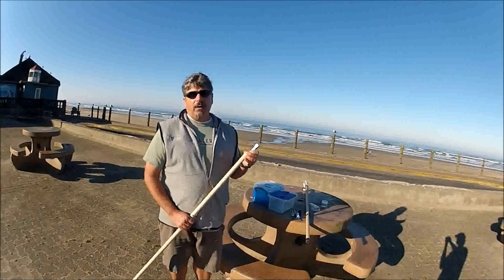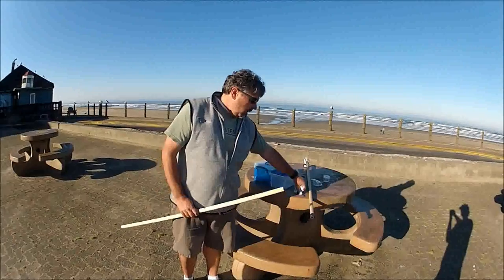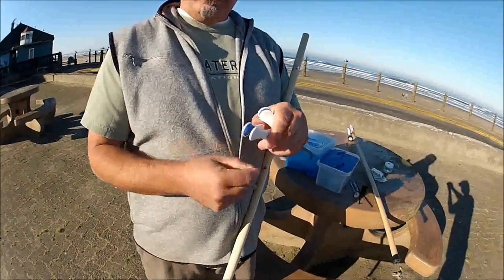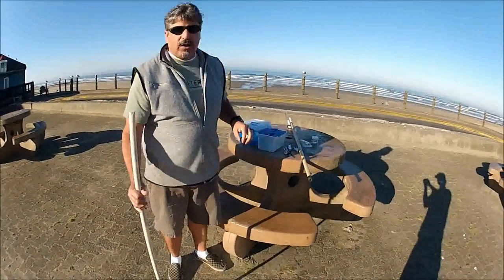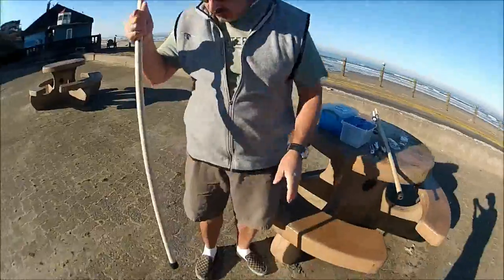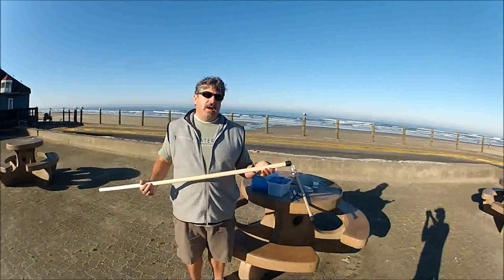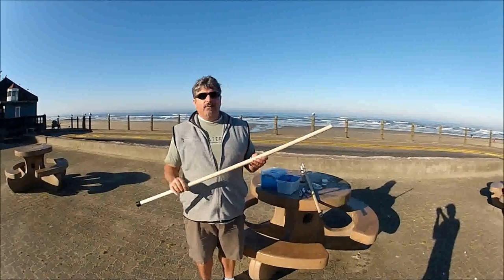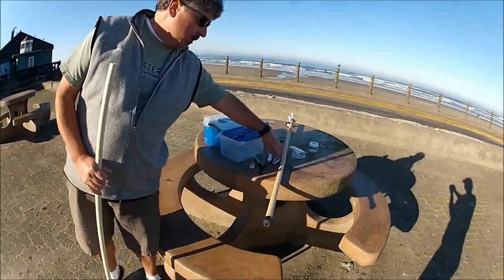You want a fair amount of these things so you don't have a logistics problem transitioning from one to another. I have the dowel and some clothespins. These clothespins have little rubber pieces that will actually bite the tabs of the Whirlpack bag. I have an end cap to use as a safety device — just a normal chair leg cap. A pack of six is about a buck and a half, so we're about $4.50 into the deal. We also have a thermometer and two tie wraps.